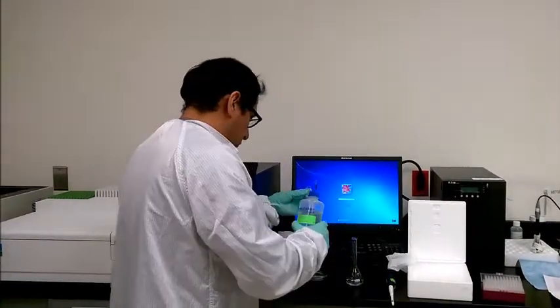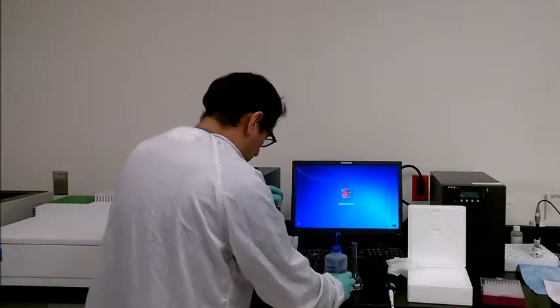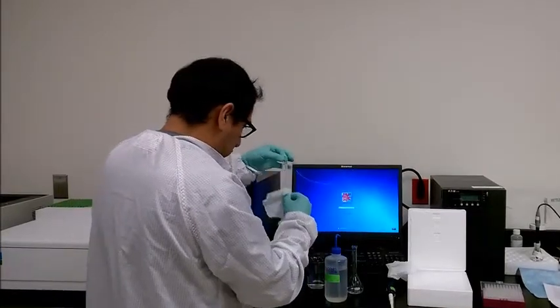We use Kimwipes to clean the transparent sides of the cuvette. We have to make sure there are no fingerprints, grease, and droplets on the transparent sides of the cuvette.